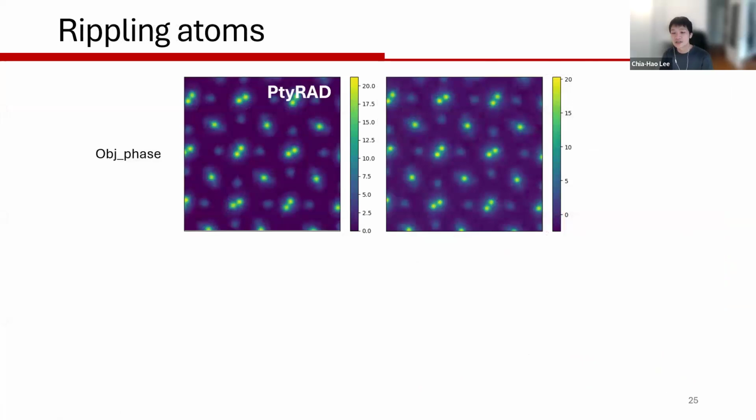And here's, I think, maybe the last example or last two examples of the object artifact. So here's a ptychographic reconstruction of the PSO dataset, and here's a reconstruction from another package that I just want to show you. Sometimes you get these rippling artifacts coming out from the atoms. It may be coming from the regularization they were using or some sort of settings that haven't really been figured out.